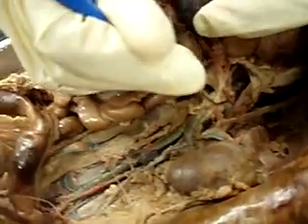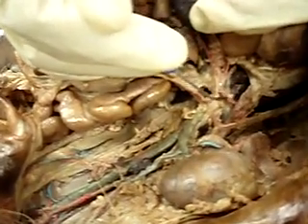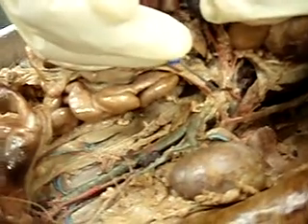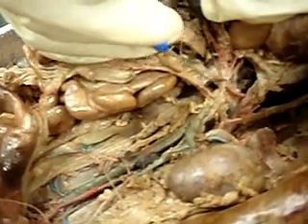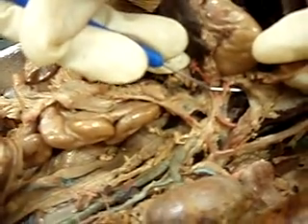So the abdominal aorta, okay. The first one, this is kind of torn. This one should be connected to the abdominal aorta. But this thing that's broken here, this is the celiac trunk. Celiac trunk branches off into 3 other arteries. The 3 arteries are right here.